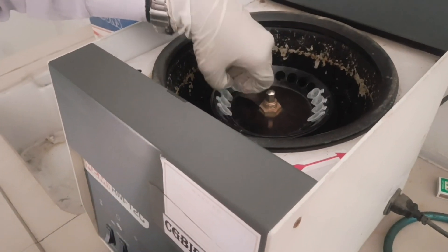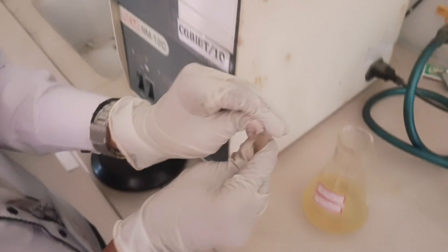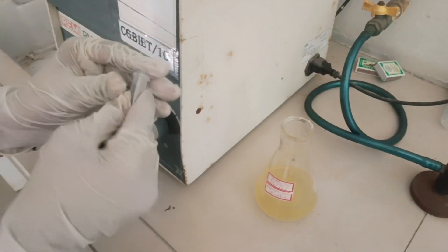After centrifugation, discard the supernatant and repeat the same step.